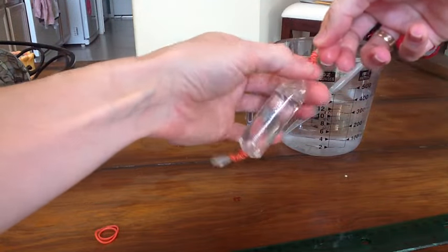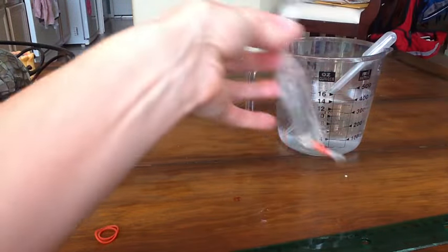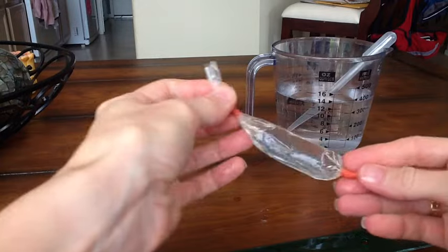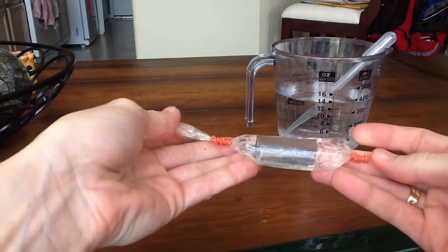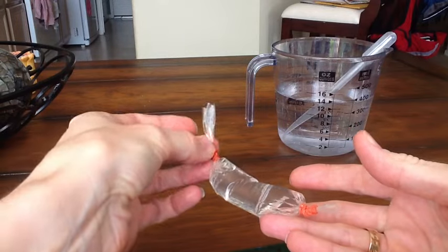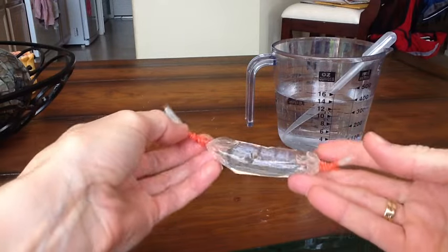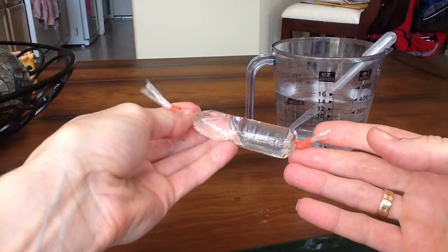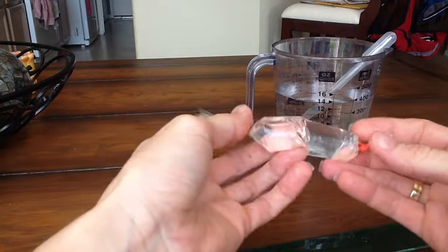And there you have it. We have a filled dialysis tubing which can now be used for an osmosis lab. There's a little extra here on the ends if you wanted to trim that that's up to you but otherwise this will be perfectly good to be used in an osmosis lab.